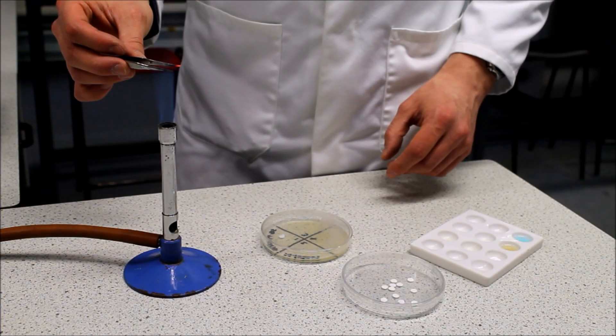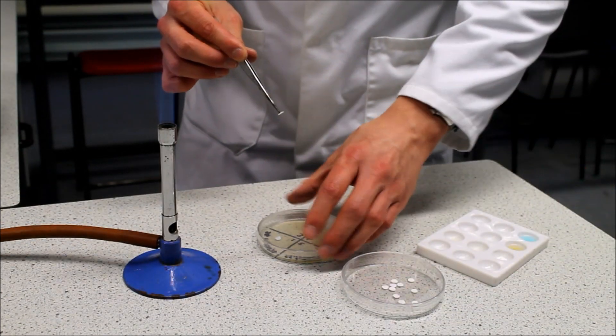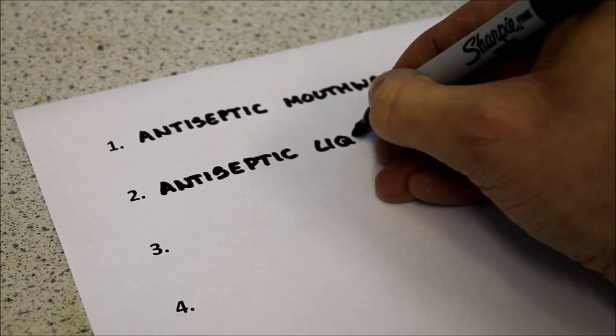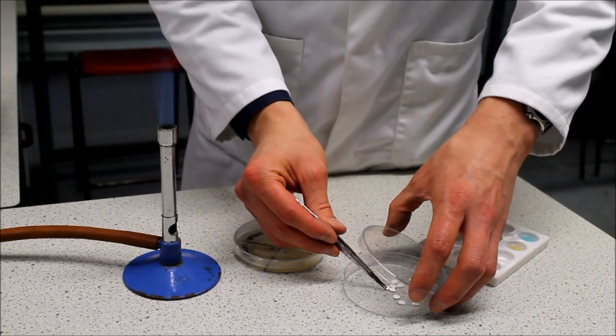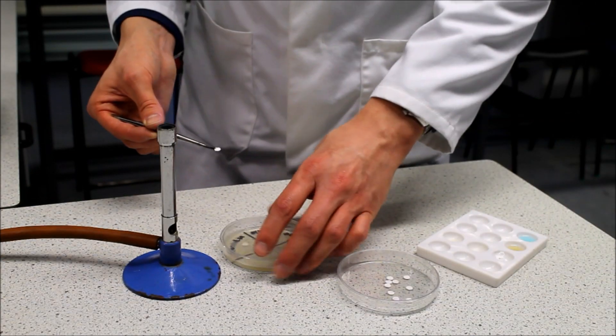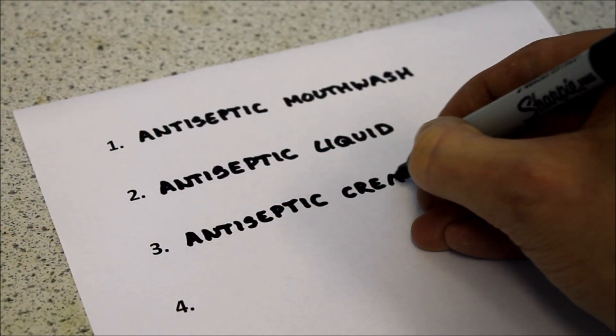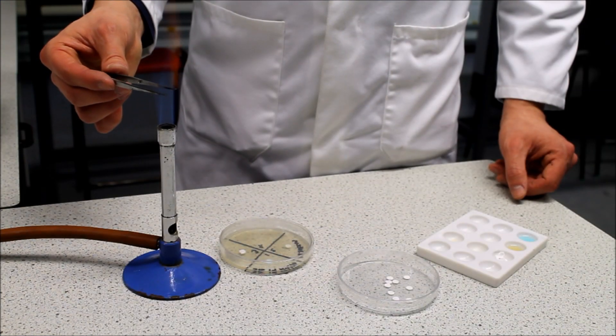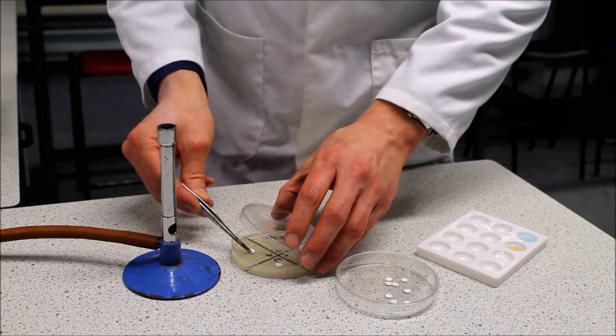This process can then be repeated for the second of the antiseptics and then the third.